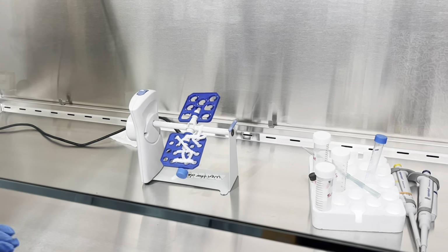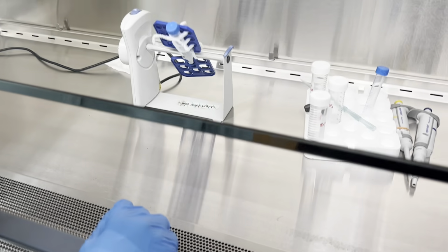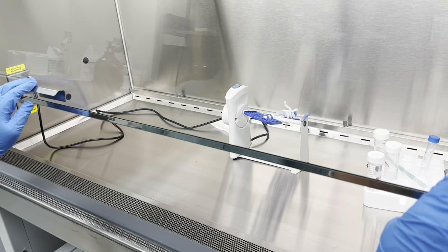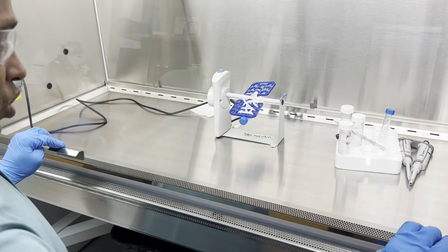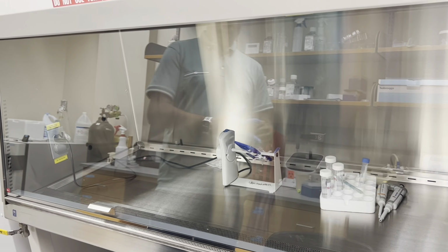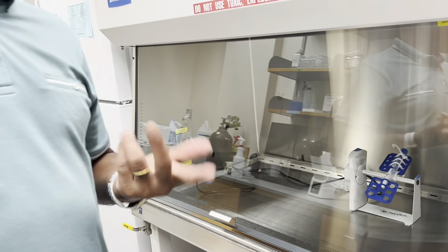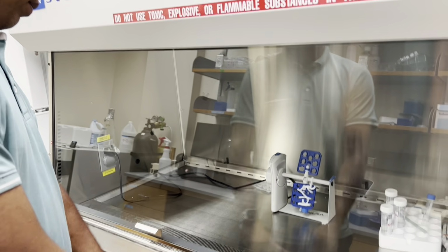Wait, what's the reasoning and why do we need it like this? Like specifically rotating slowly? It's mixing and reacting, but if we do it fast, like in a centrifuge, it will be too violent. And especially when you add protein, then the protein will be precipitated out. Okay, so that's a reason. Cool.